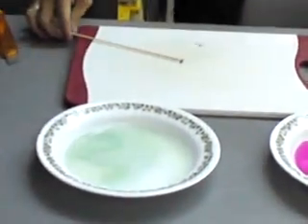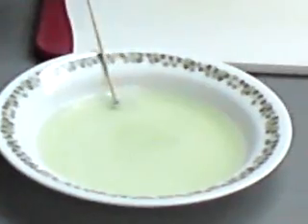Let's see what happens — observe the difference between that reaction and this reaction. Wow!